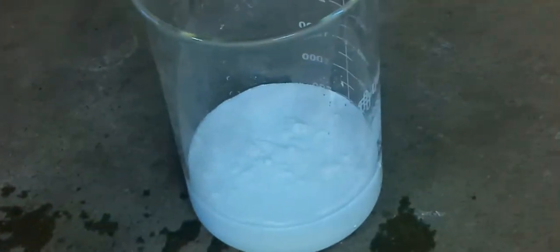I'm satisfied — that's a pretty clear rinse water, and there's the silver chloride. You can see it's pretty white, so that'll dry out, and then we will do the next step of the process to remove the chloride and just have pure silver precipitate. That'll conclude this video on the refining process with nitric acid.